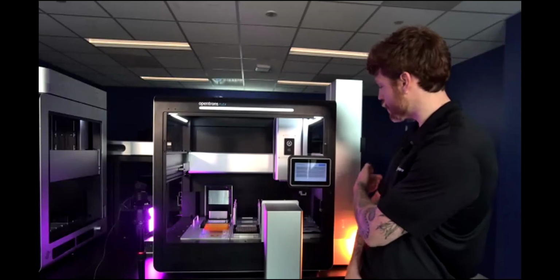In particular, we're going to cover how you can use the brand new Flex stackers, which you can see over to my side here, to really easily scale this workflow while working within the Opentrons ecosystem. And we're also going to highlight the use of our new low volume 96-channel pipette, as well as some of the other on-deck modules that you'll need for this workflow, whether that's the thermocycler, heater shaker, or magnetic block.